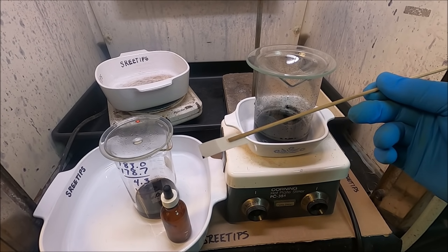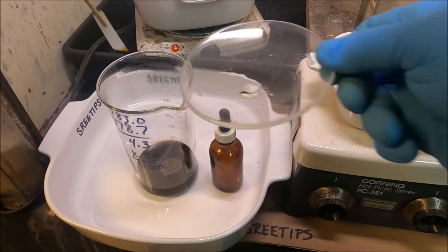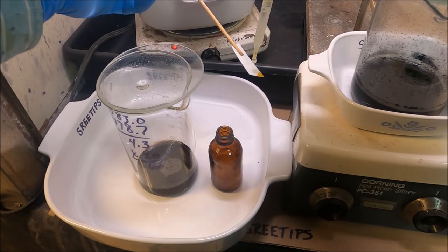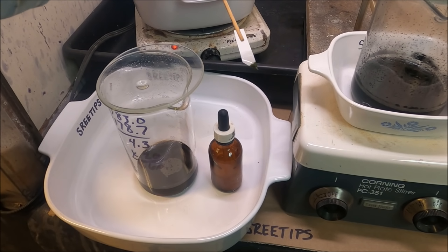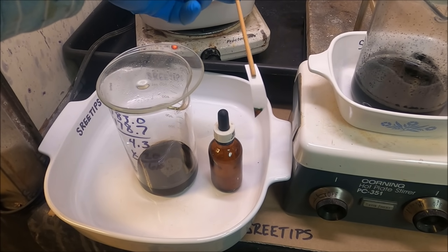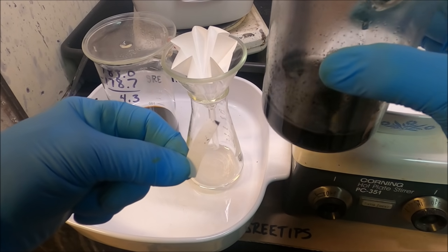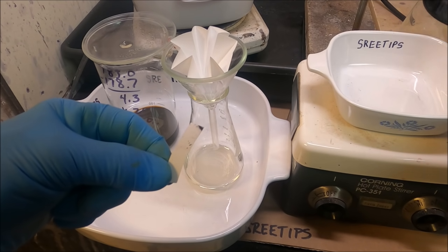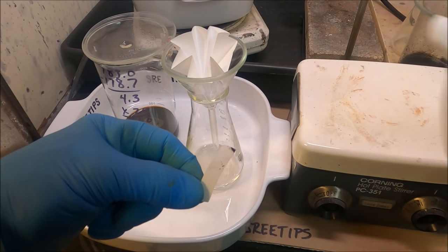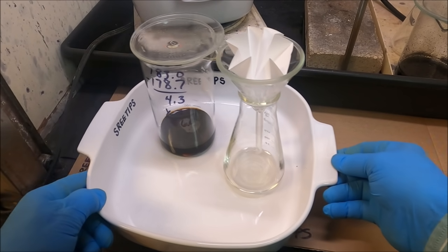The reaction on the sulfuric acid sample just stays black. Now I'll stick a piece of filter paper down into the platinum/palladium solution, get a little bit of the stuff on there, and do a stannous test. It turns very dark — I can see a green color towards the edge and an orange color on the bottom. Green and orange is what I should see for platinum and palladium. The stannous test on the gray material didn't produce any kind of color, so I'm going to call that experiment a bust. Boiling that gray material in sulfuric acid gave no good result.